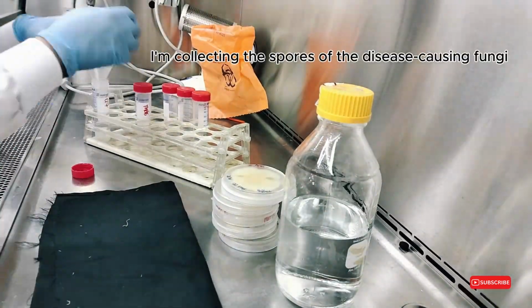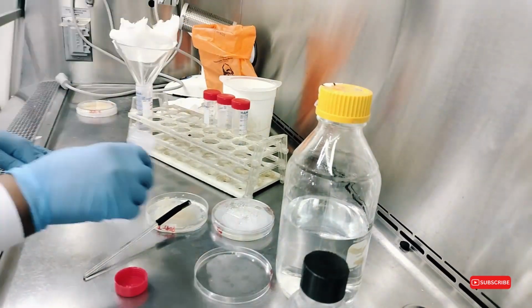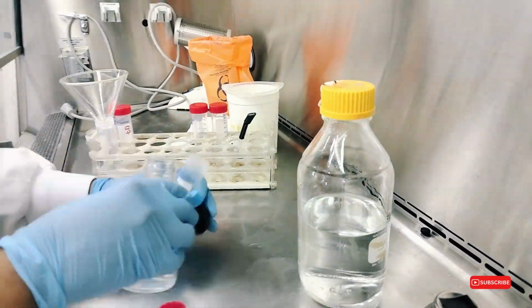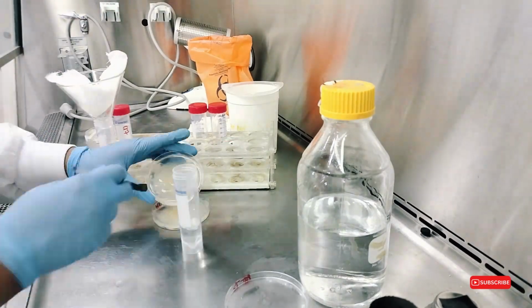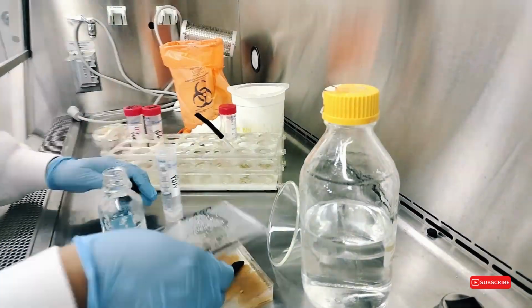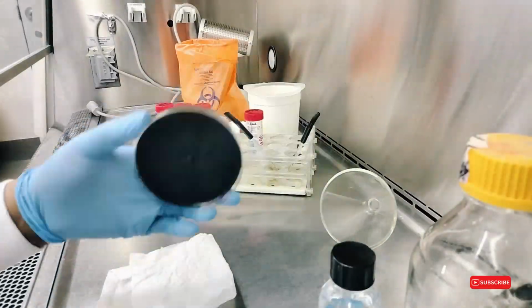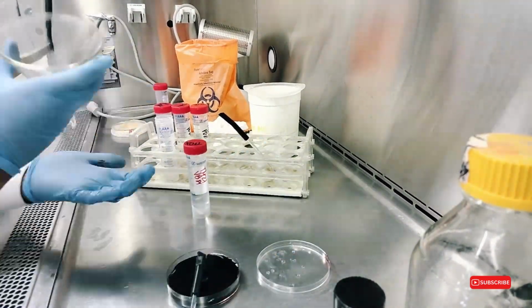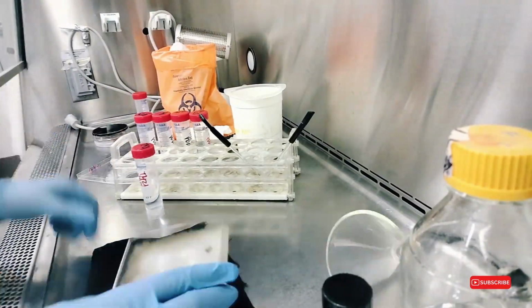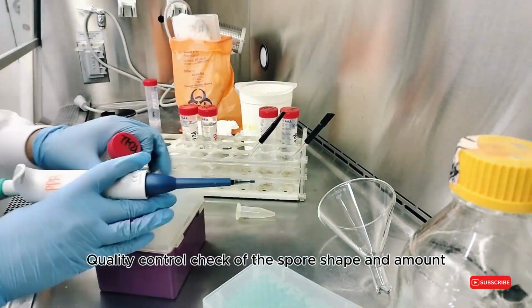I'm collecting the spores of the disease-causing fungi. Quality control check of the spore shape and amount.